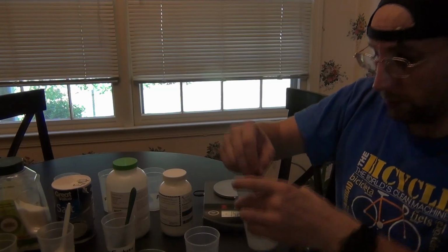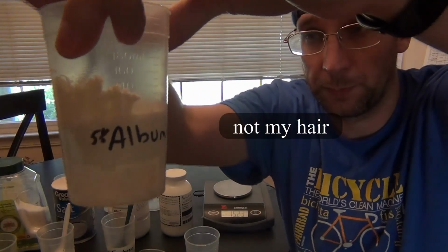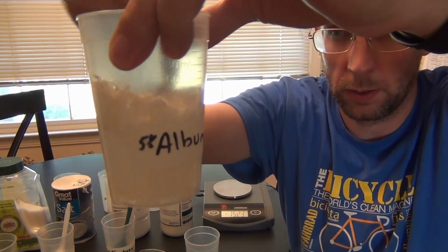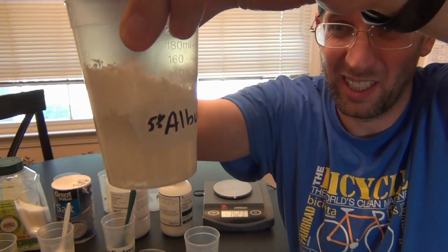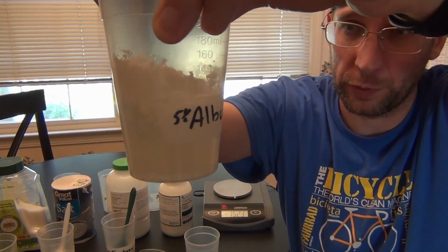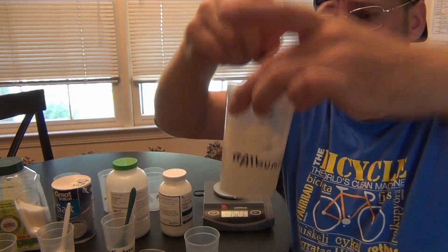Let's see how well this goes in. So, yeah, albumin, even 5%, isn't going to go into solution very well, but I'll do my best in a little bit to get it better.